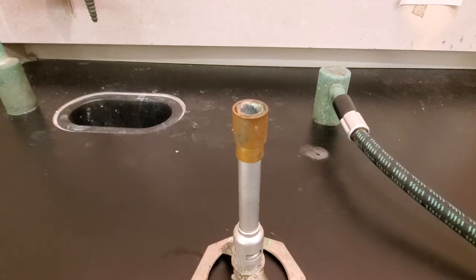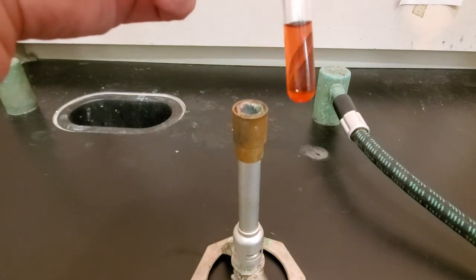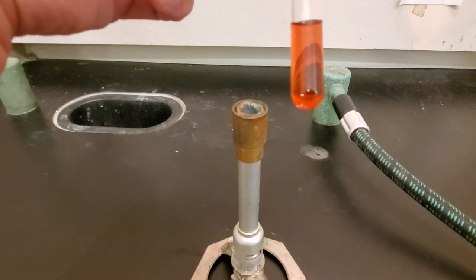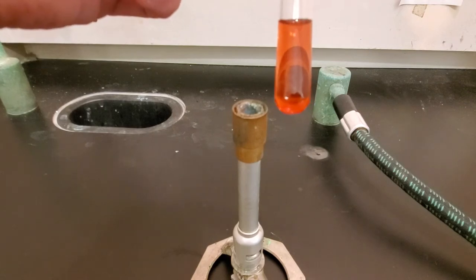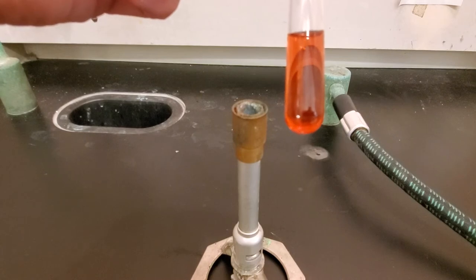This is the borax bead test. The borax bead test tests for a couple of different ions. One thing we always want to look at is that if your substance has a color, it would be a good time to do the borax bead test, because the ones that are positive for the bead test are ones that aren't white solids or don't make colorless solutions.